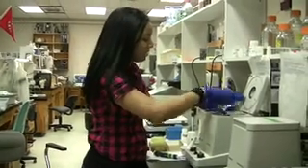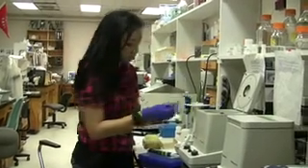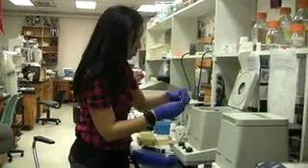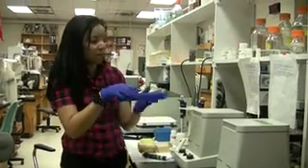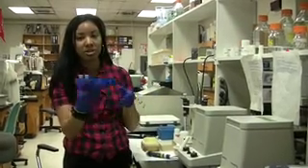We've completed the last step now. I'm going to go ahead and take them out of the centrifuge. You can take the column out of each one of them and just close it. This is the very last step — you can go ahead and check for DNA quality in agarose gel. But for now, I'm going to place them in the freezer.